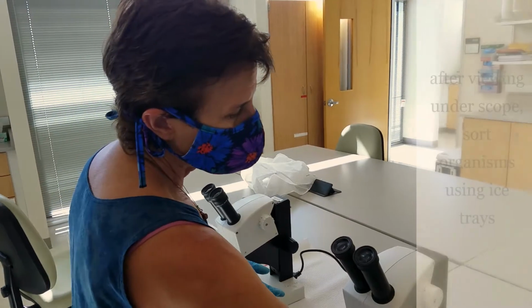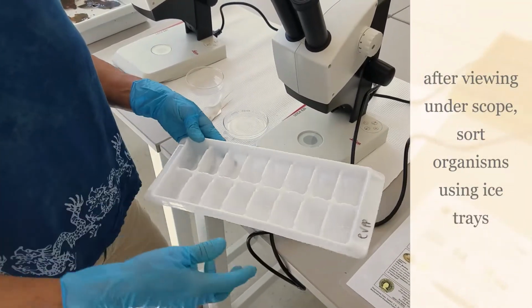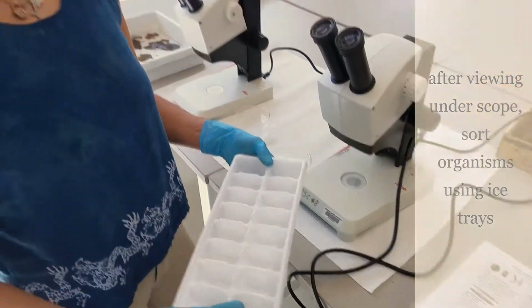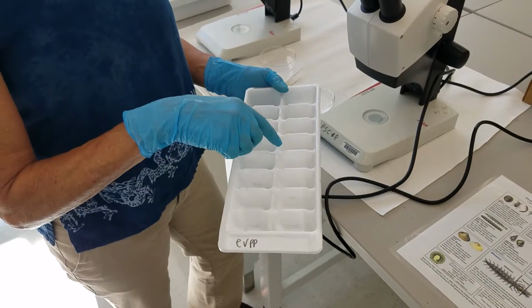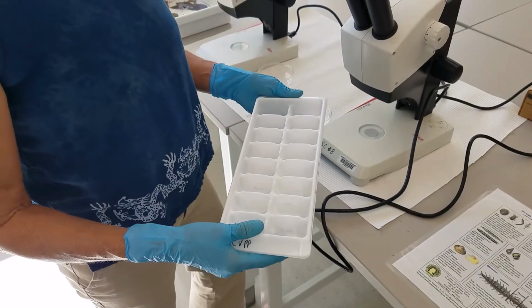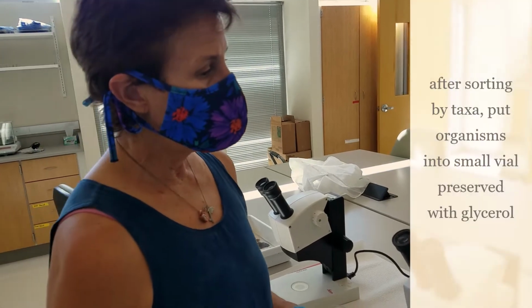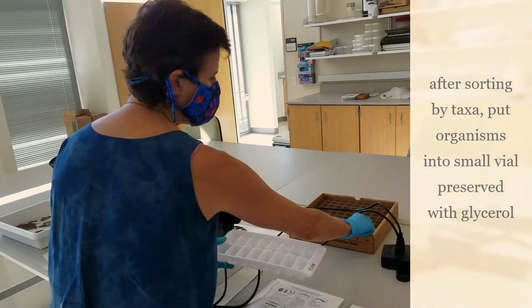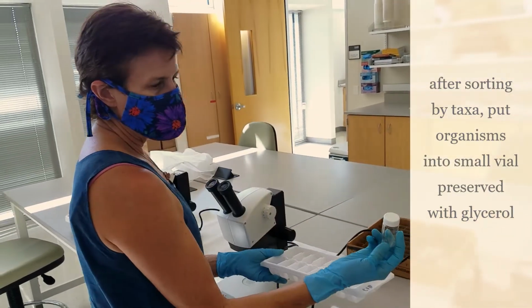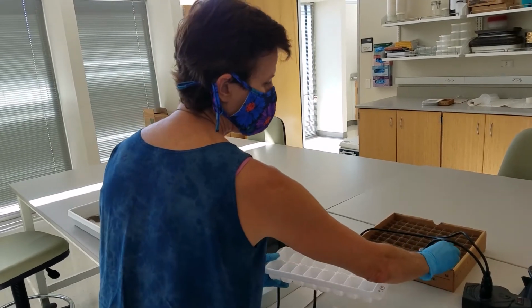Normally we sort them into a regular white ice tray. So you would put all aquatic earthworms in one, clams in another, and so on, and then we preserve them in a glycerol solution. After we've sorted them in this tray, we put them into a small vial with glycerol so that we can go back and verify the counts.